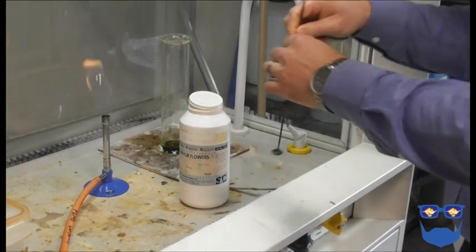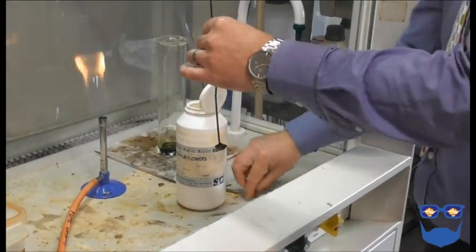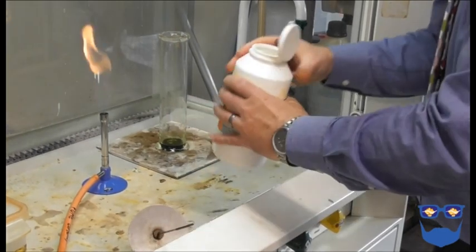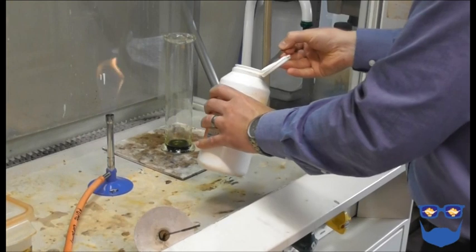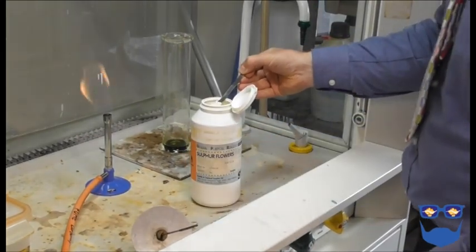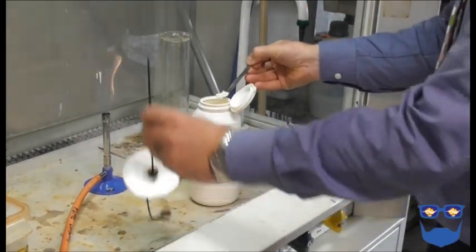Put some sulfur powder into the deflagrating spoon. I use a spatula to transfer the sulfur so the students can see everything clearly. Ensure the work area is clear and the fan in the fume cupboard is on.